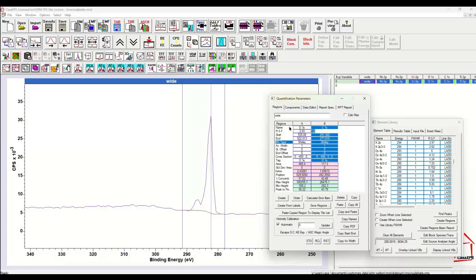I can force an update by entering hash into the RSF field and pressing return. And now you see that not only is the RSF and the name field brought in from the element library, it has updated the tag field. So now I have two regions and there's a mass, the correct mass, associated with both of these two regions. How can I see this?